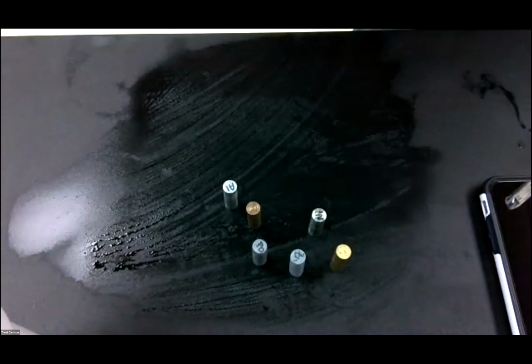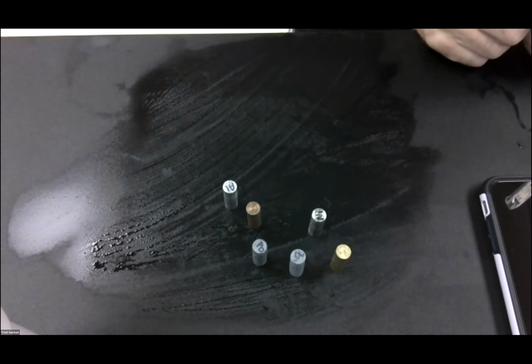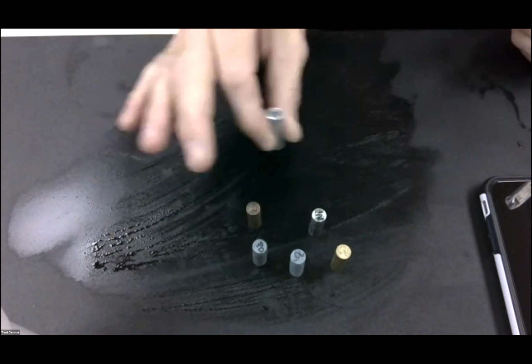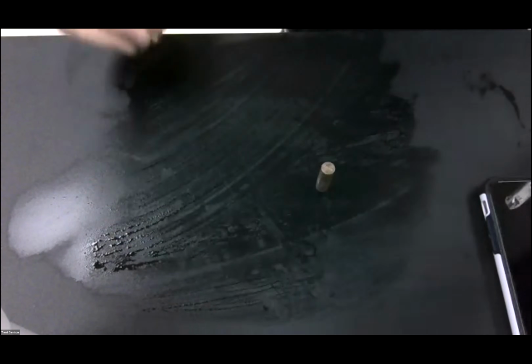The density lab could be done with any material, but today we are going to find the density of metal samples. I'm not asking you to get the density of all 6 of the metal samples. I am merely asking you to select one of the samples. For today, I will choose the copper. We all know copper looks like that orangish brown metal, and so we will do copper today.